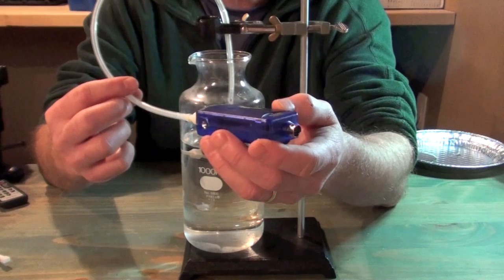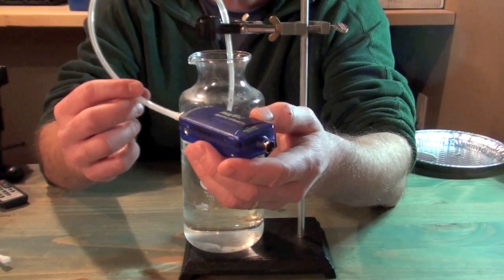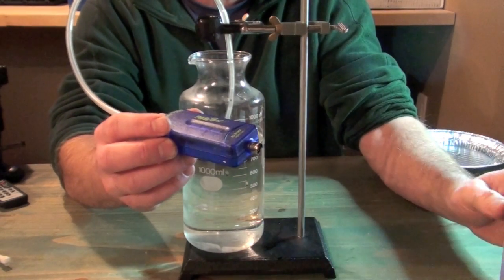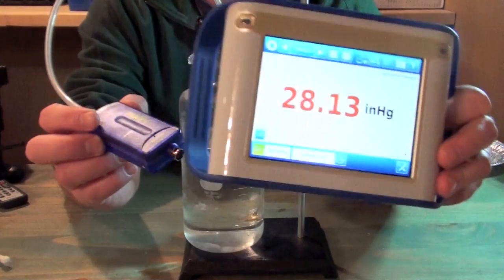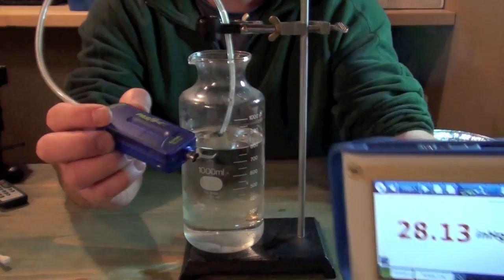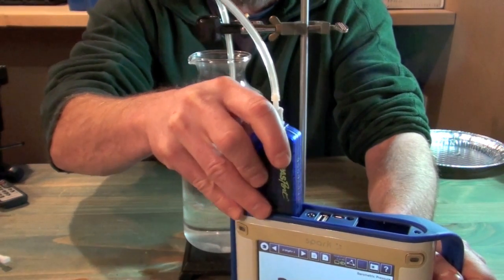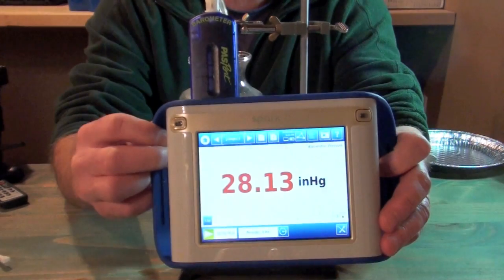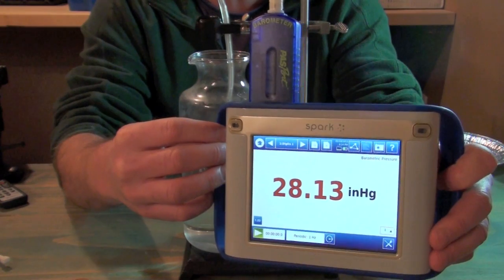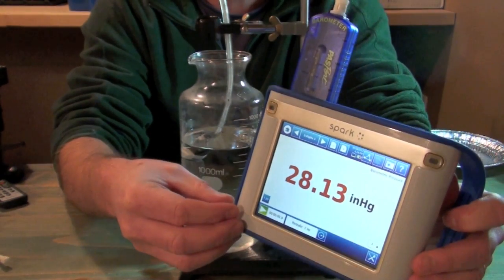So what we can do is do that right now. All we need to do is connect this to a computer. You could use something like the Pasco spark unit. That would work really well. So I'm ready to measure pressure with this right now. All I would have to do is plug this into the spark unit and start collecting pressure readings. But I'm going to take this to a full-fledged computer so you can get a better look at the readout. So let's go do that now.